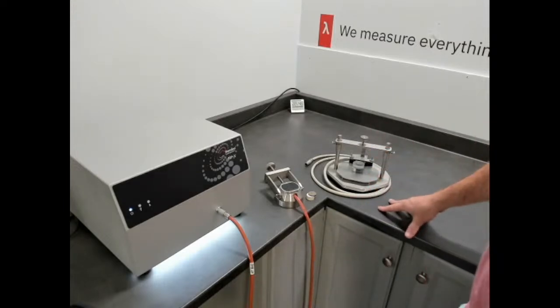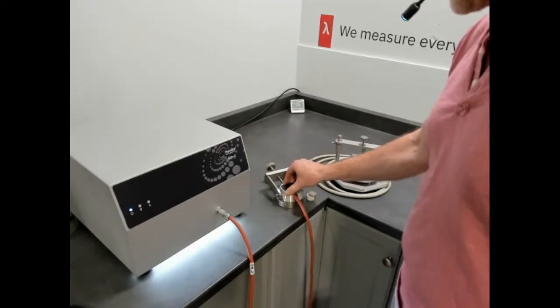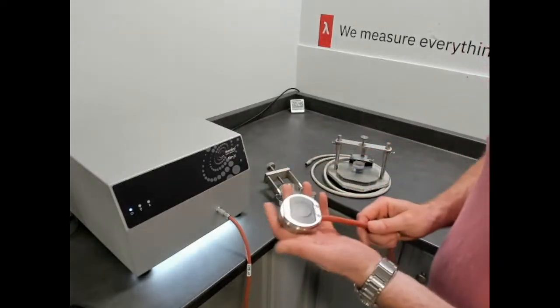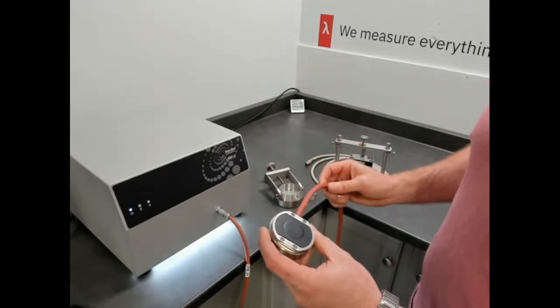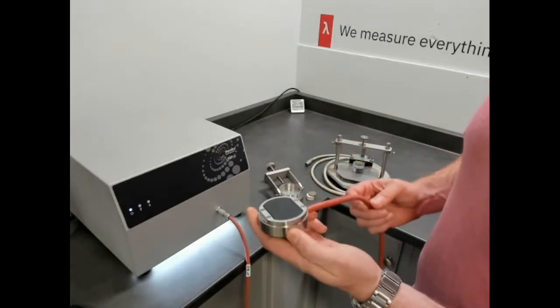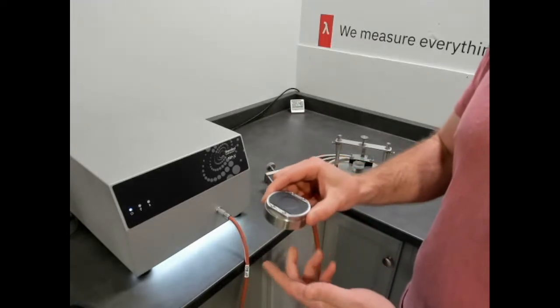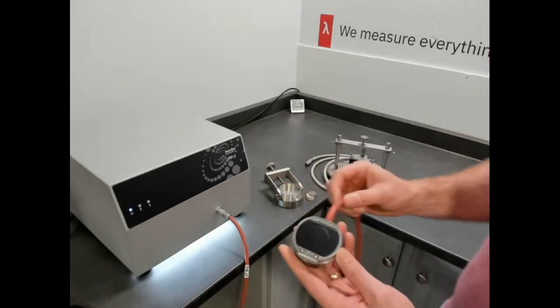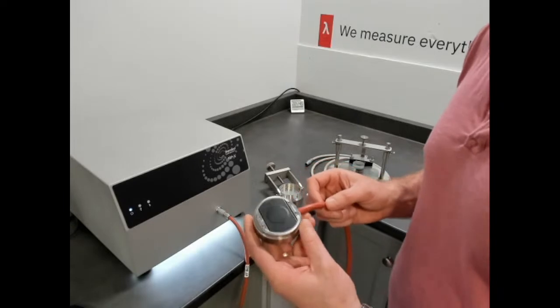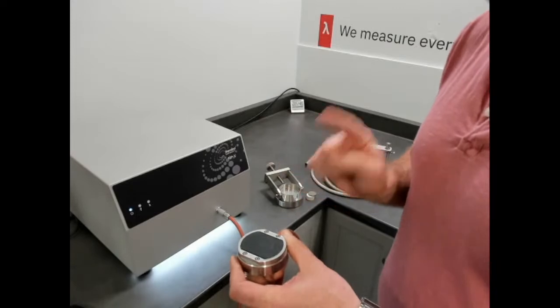It just depends on if your material is in fact directional due to process or added fillers, etc. So this is our additional sensor that's available on the MP series. This is our high temperature one that can go up to 200 Celsius. Its construction is absolute, so this is called the modified transient plane source, but the absolute version. What makes it absolute is that it follows the ideal theory of transient plane source, described in the 22007-2.